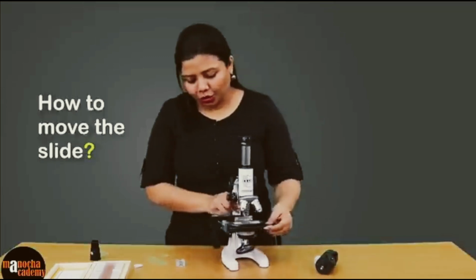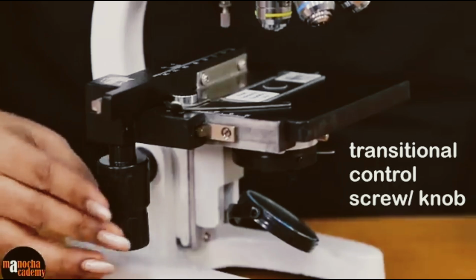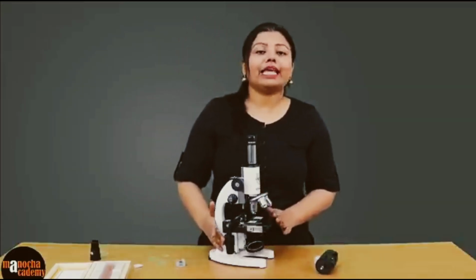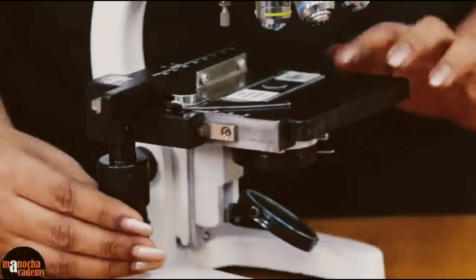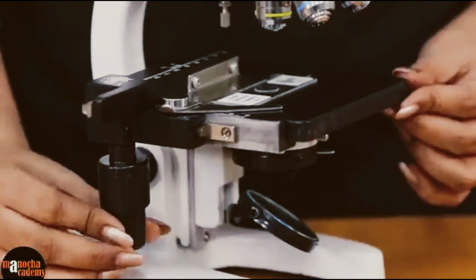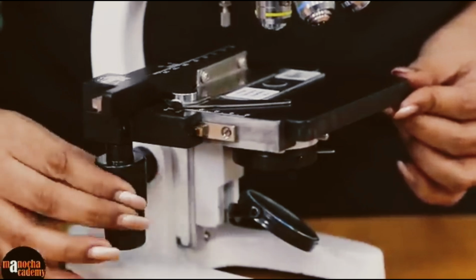For that, you usually have this kind of a screw attached to your microscope. Certain compound microscopes may not have this screw. In that case, you have to manually move the slide. However, if you are provided with these screws, as you can see, we can move the slide right and left, backwards or forward.